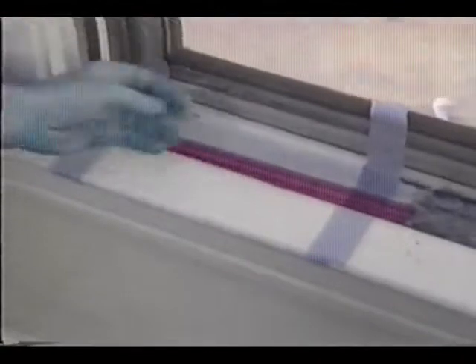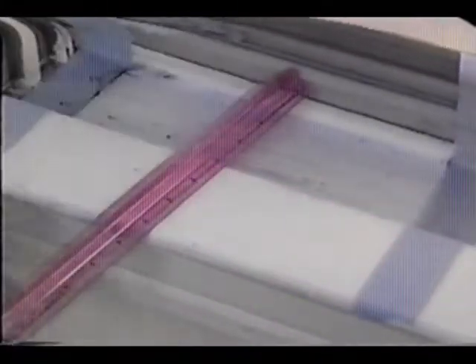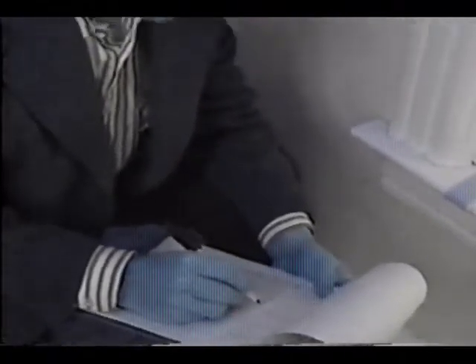Before you remove the tape or template, don't forget to measure the wipe area. Use a tape measure or ruler to measure the wipe area to the nearest eighth of an inch. Record the measurements of the area on the field sampling form.